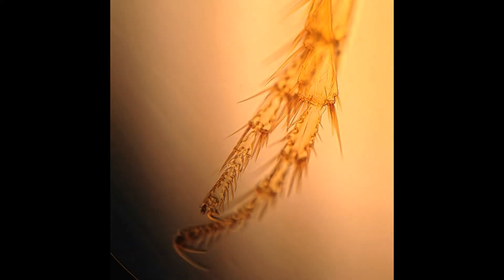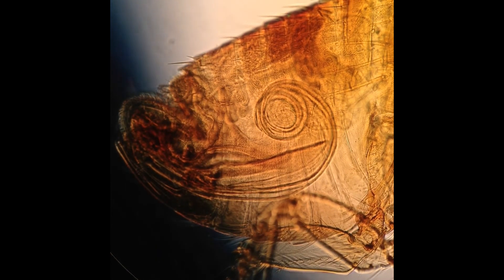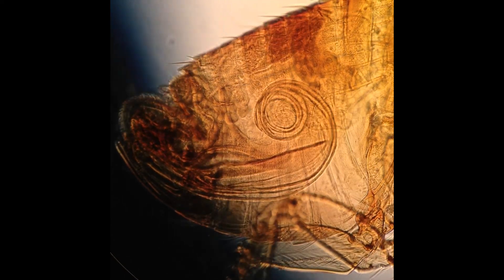Look at those legs. I'm going to adjust the condenser again — opening it up, now closing it down. Look at the intestines inside. Here's another illustration of depth. This is all the way closed down on the aperture — number two. Now I'm opening it up, so the depth of field is less. But it's good for focusing on a certain part and taking a picture. I'm seeing the inside swirl, and here I'm seeing the legs, the spines, and the hairs on the body. But if I close down — there you go, you see everything at once. Refocus a little bit, you see the inside.